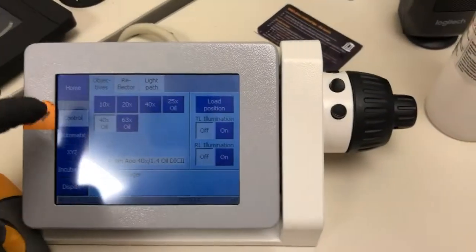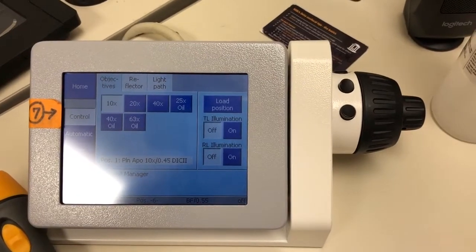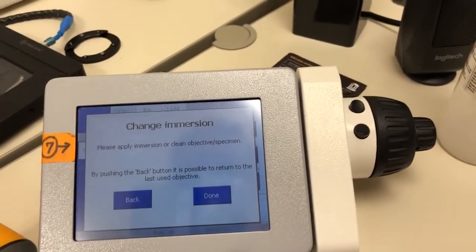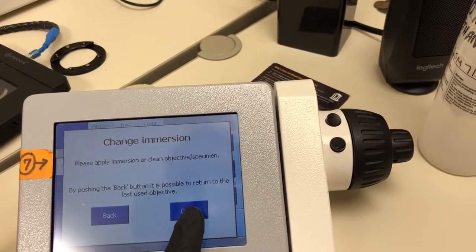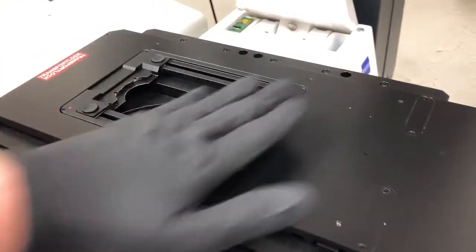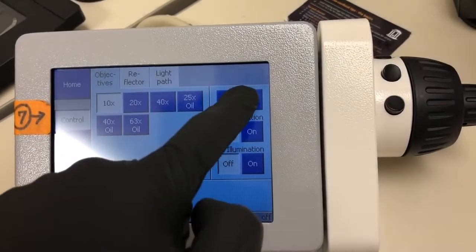You'll see that because it's changing from oil to an air objective, it gives me this prompt to change the immersion, meaning I should either put on oil or clean oil or whatever it may be. In this case, it's to clean the oil that was already done by the previous person. I'm going to say done. And then I'm going to lower the 10X objective so that it is not near the top of where the stage insert is going to be. To do that, I'm going to press this load position.